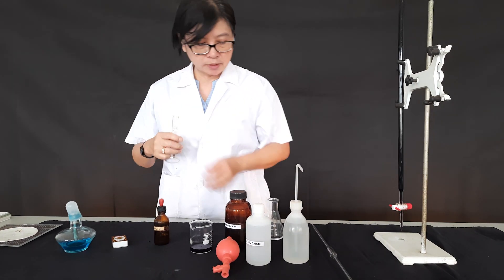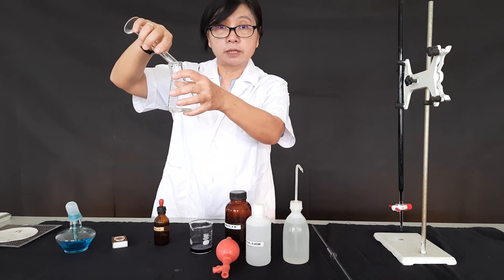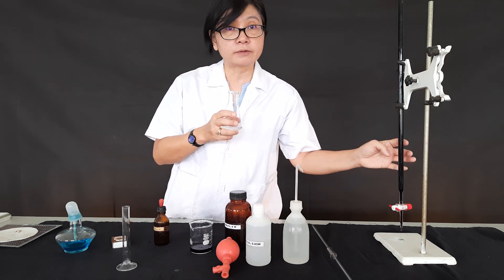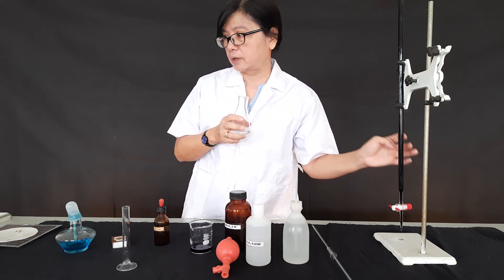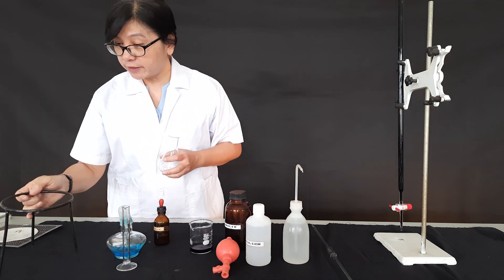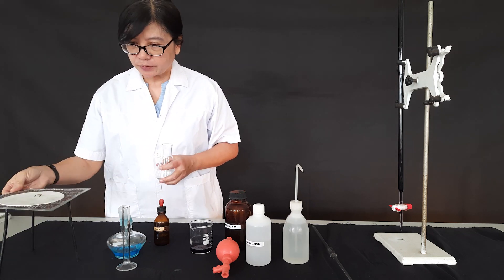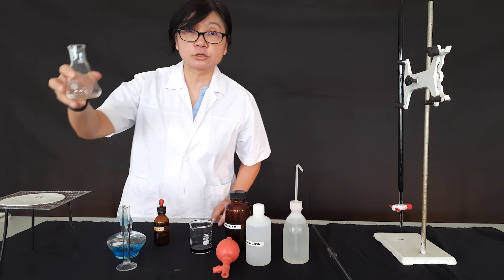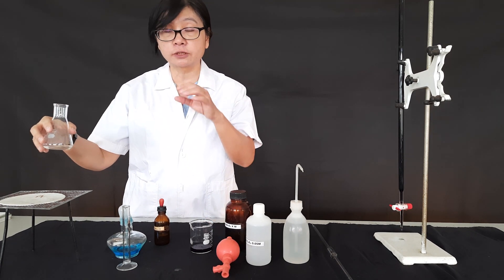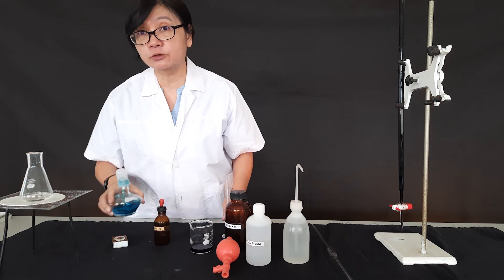I add the sulfuric acid into the oxalic acid solution. Once again, we don't need an indicator because there is a change of color from the purple KMnO₄. We also need a preliminary step: we need to heat up the solution to speed up the reaction, because at room temperature the reaction will take too long.